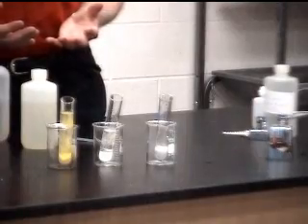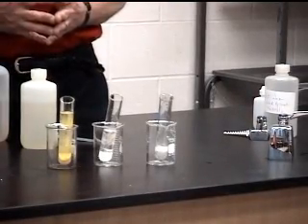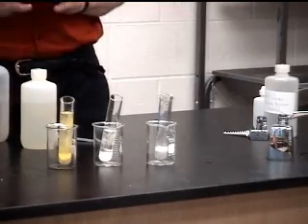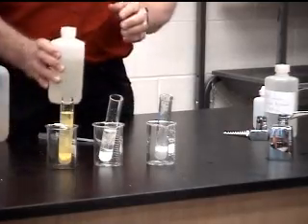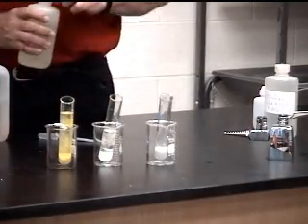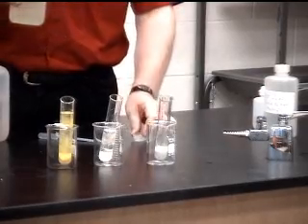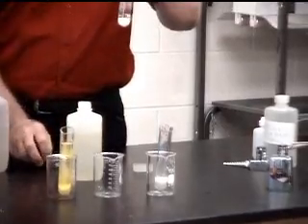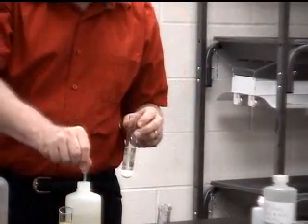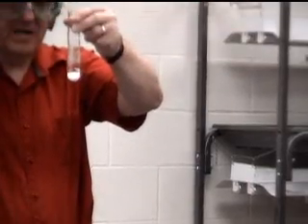And what someone might do is say, oh, look at this lead chloride. It would be safe to dump in a place like Minamata Bay in Japan. And it would be totally safe. You can see it is insoluble in water. But is all of the lead out? What we're going to do is now add some potassium iodide.